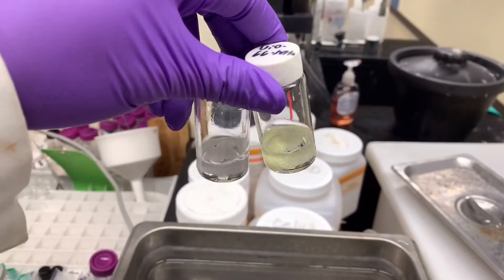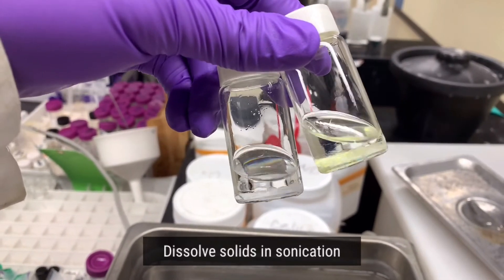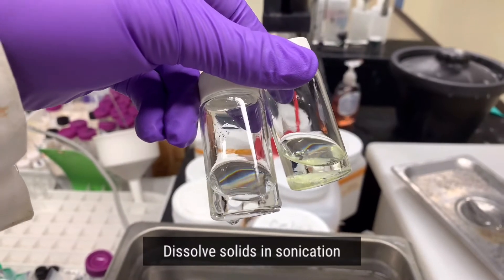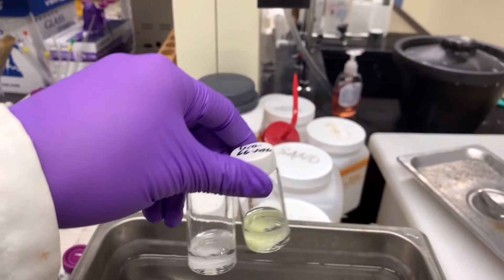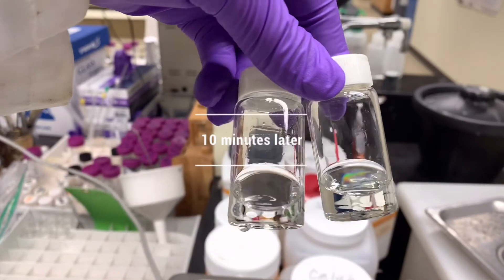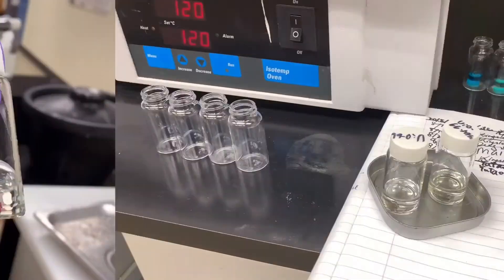The next step is to dissolve the mixture totally in the solvent through sonication. After sonication, we can see that all the solid in the vial is totally dissolved.